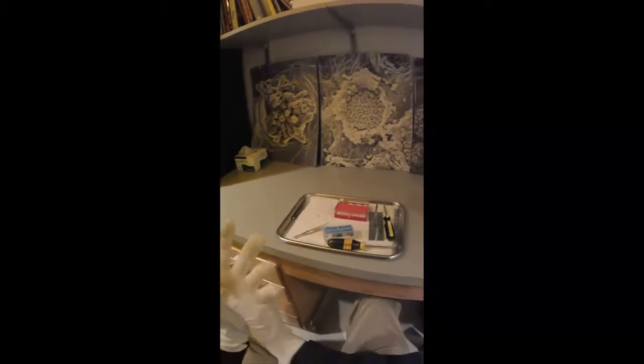So here you see our sample box and we're going to work on a sample tray and wear cotton gloves so that we don't get oils on anything that goes in the microscope because that could gum up the high vacuum.